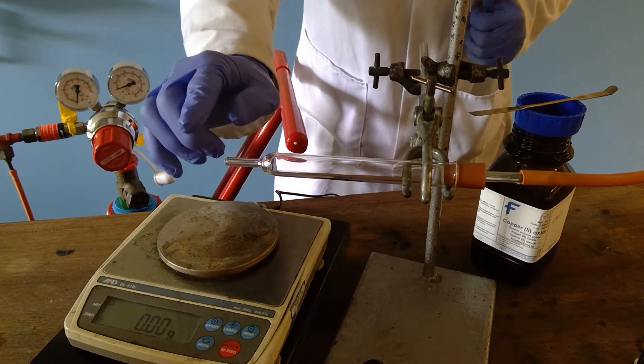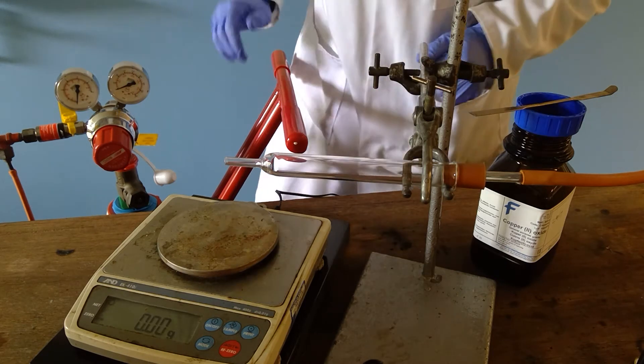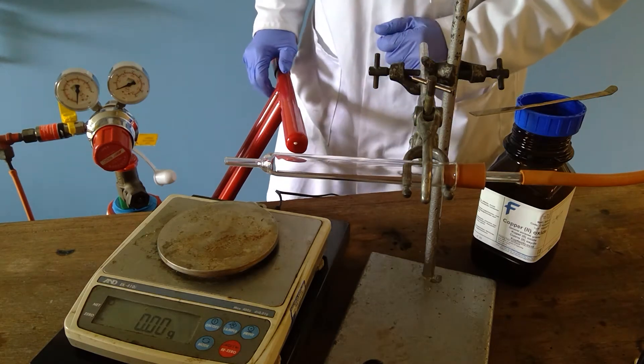We will light the hydrogen at the end. Hydrogen burns, but obviously hydrogen-oxygen mixtures are explosive, so we need to be a little bit careful.